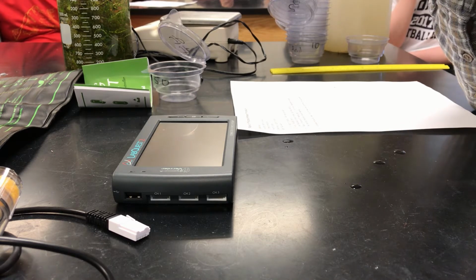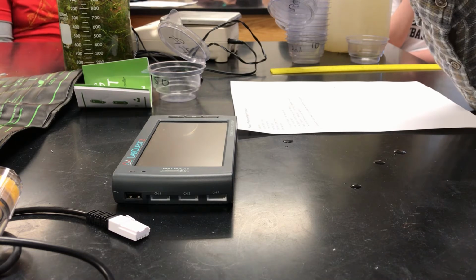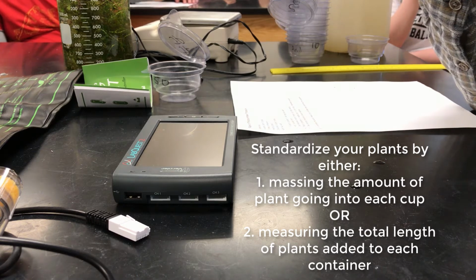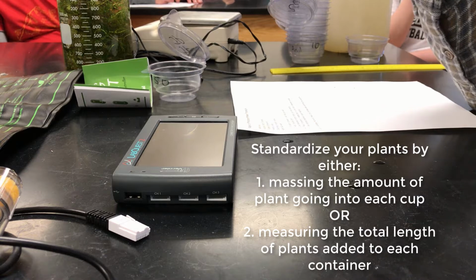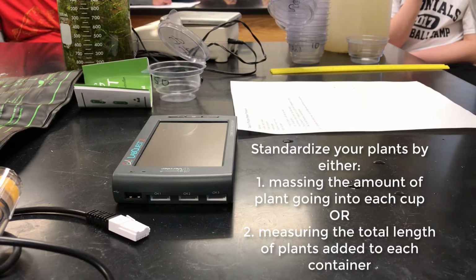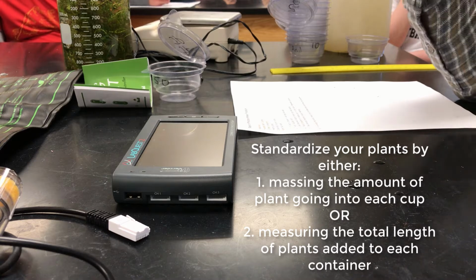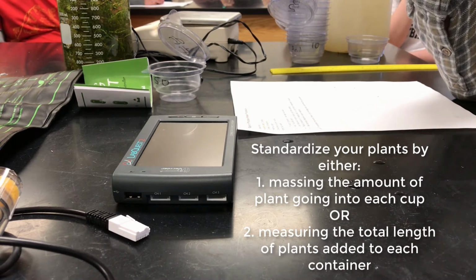And I'm going to recommend that you do one of 2 things as you're standardizing your plants. One is you can do it by weight. So you can dry these off as best you can, get a piece of paper towel, rest them on there, get most of the excess water out of them, put them on a balance and take an initial mass and know what the mass is in each of the cups, and therefore you can figure out the photosynthesis or the amount of dissolved oxygen per mass. That is one way to do it.